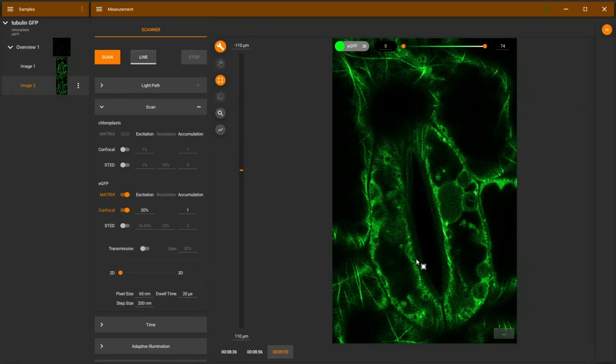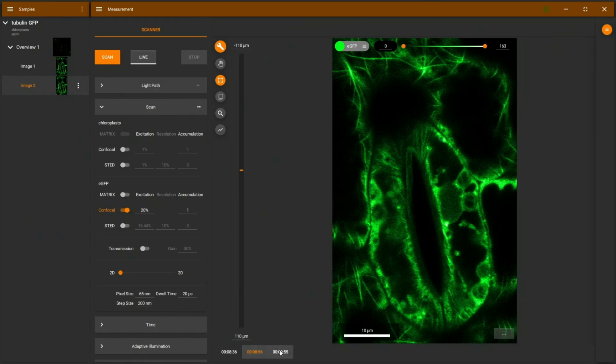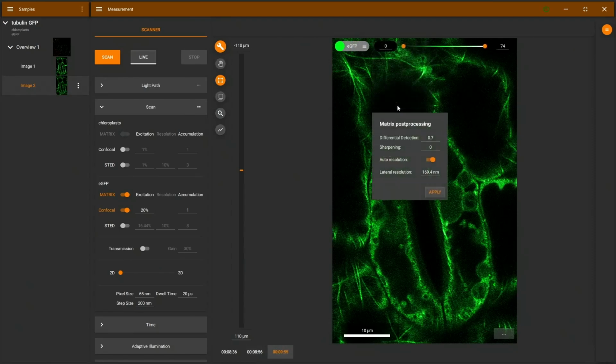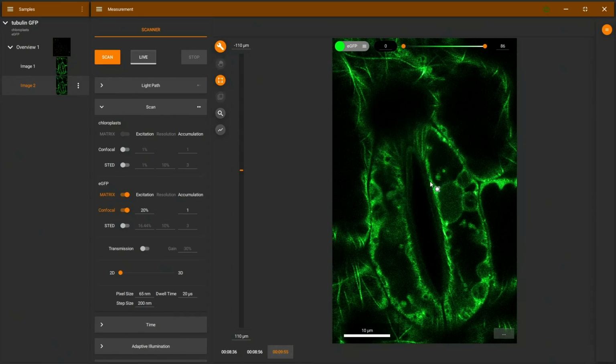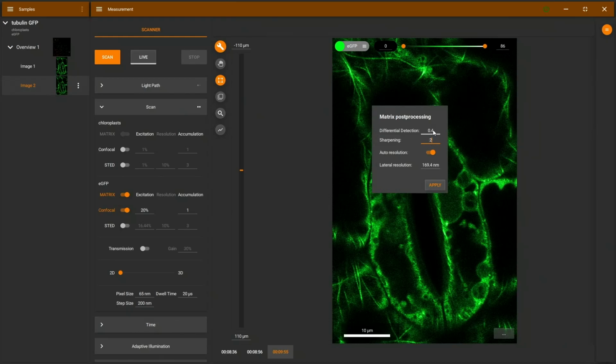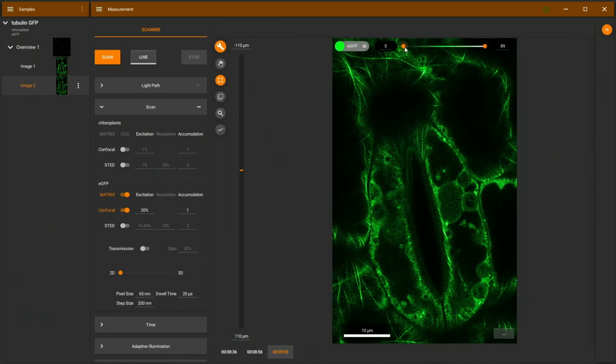Now we're rejecting lots of out of focus light, and we can see very fine structures in the densely packed areas. So what was previously a little bit hidden in haze becomes visible. The fine structures become more sharp. If I use a little bit less of this post-processing, so less sharp, I will get also a nice image, but there's also a sharpening function or deconvolution function. See here? And that will do a slight deconvolution to increase the resolution a little bit more.